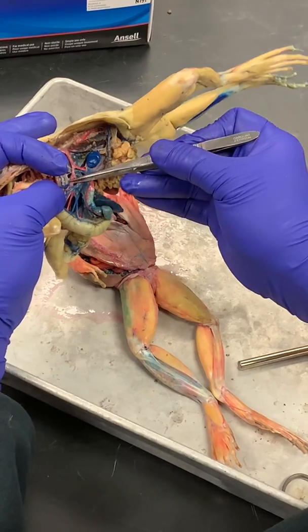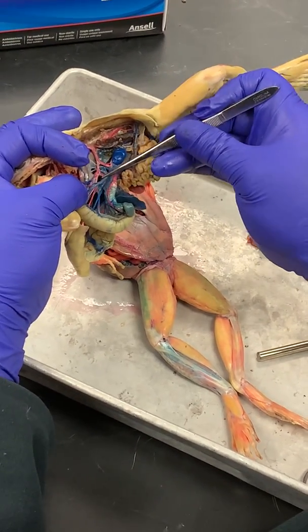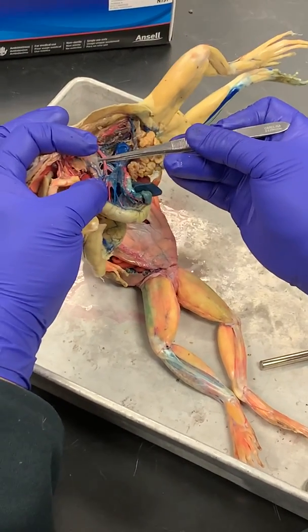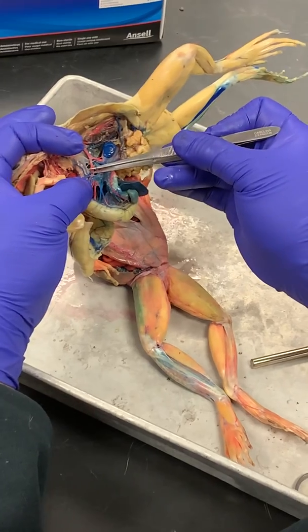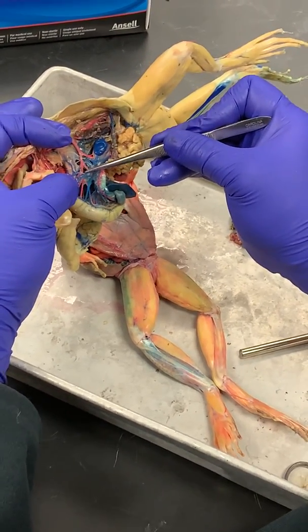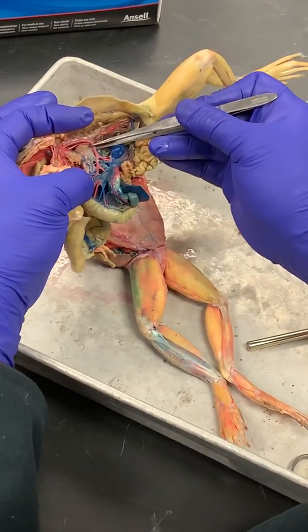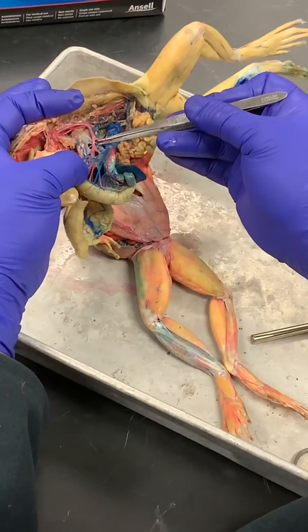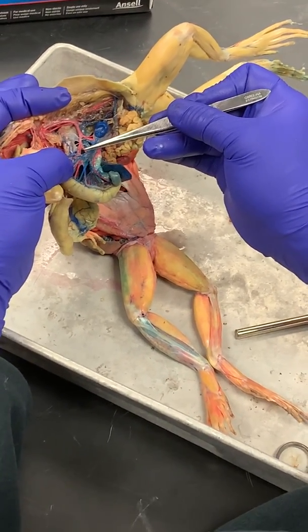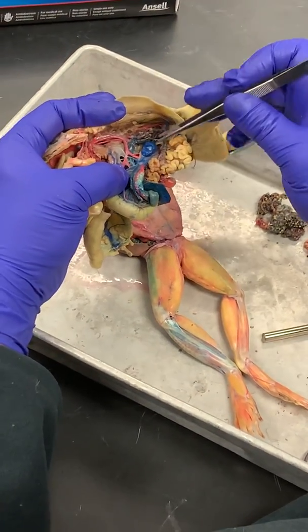All right, so there's one here. This is the hepatic artery, and the gastric artery. So the celiac trunk artery splits into the hepatic and gastric. So the celiaco-mesenteric trunk artery branches into the celiac trunk, which branches into the hepatic and gastric. And then there's a mesenteric branch that goes most posterior.